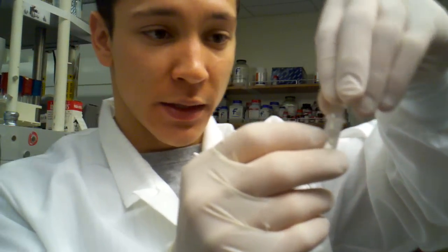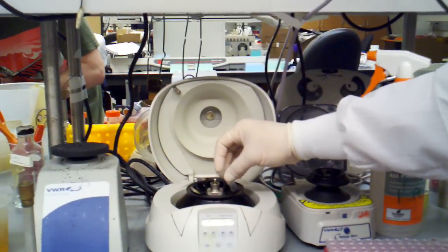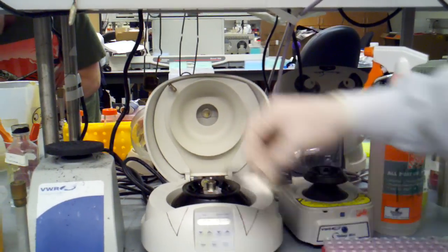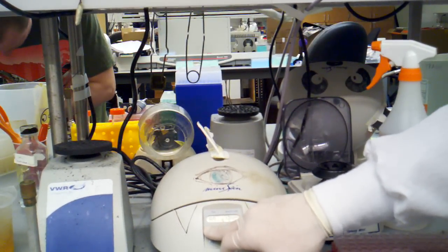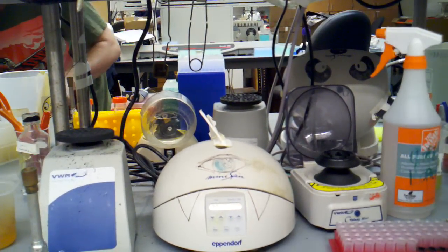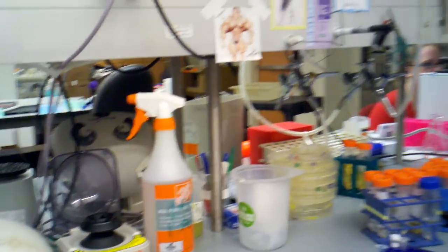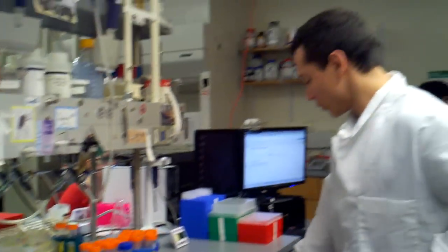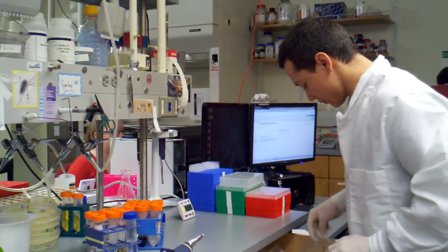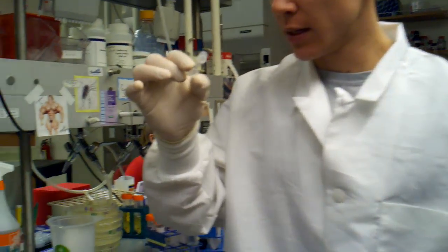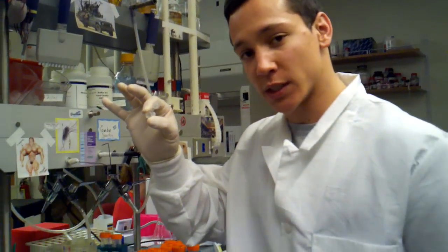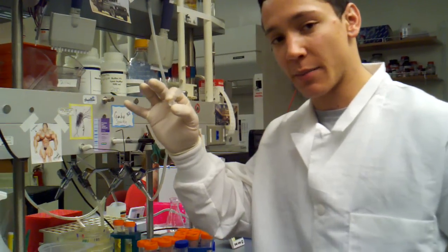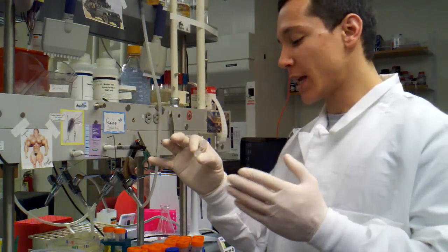In order to expedite that process, we're just going to spin it down. I'm going to leave that 850 microliter balance in there; that should balance fine. We're going to take our time back down to 30 seconds. That's spinning down the membrane, which looks like a little white membrane that captures all the DNA but lets all the other fluids go through.